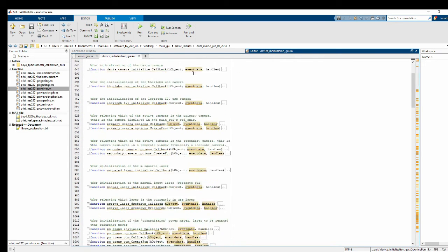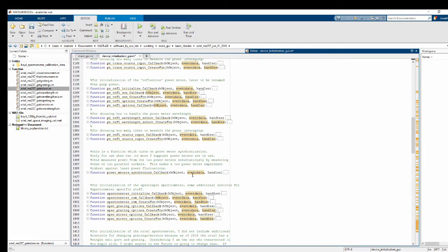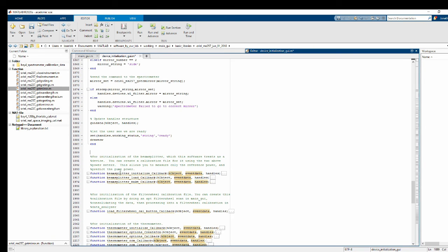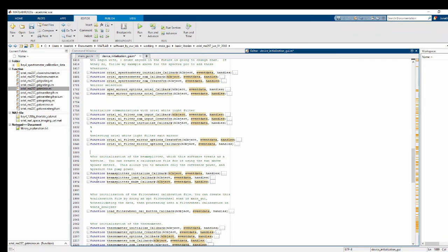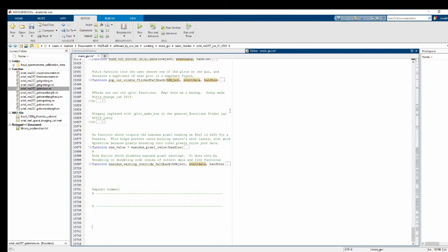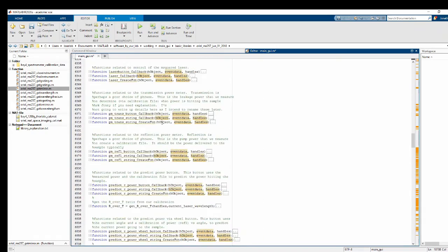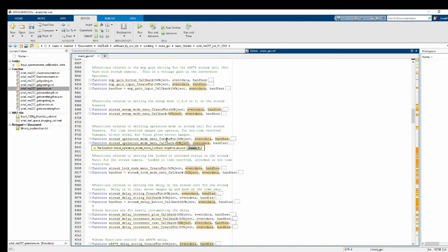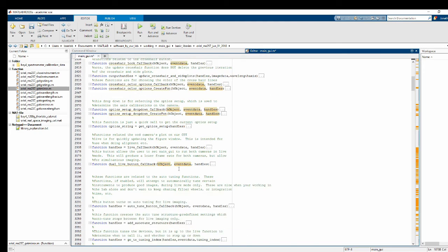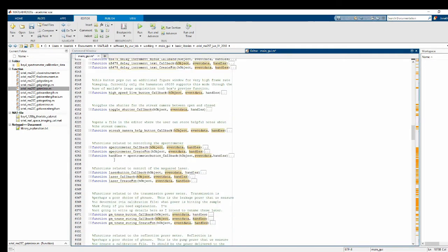Oh, and since we are all done working in device initialization GUI, let's just go ahead and move these to a more reasonable spot in the code. They're pretty similar to spectrometers, so I'm just going to put them right underneath the two spectrometers we have. 1, 2, 1, 2. Okay, looks good. Save it. And this one is also similar to spectrometers, so I'm going to move them to be pretty close to where our spectrometer buttons are. In here somewhere. Oh, I think I passed it. Here it is, spectrometer.